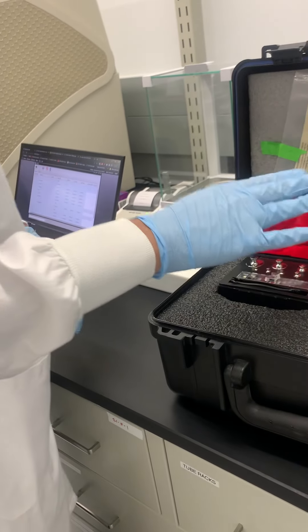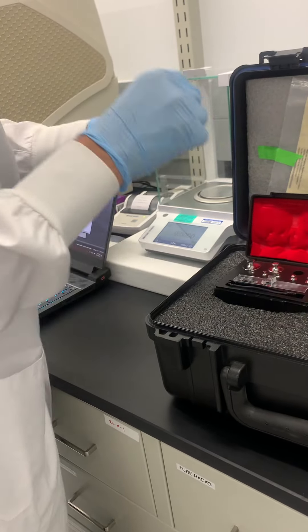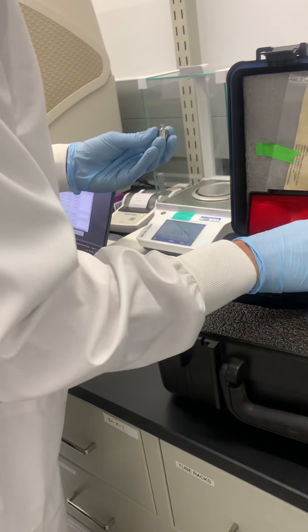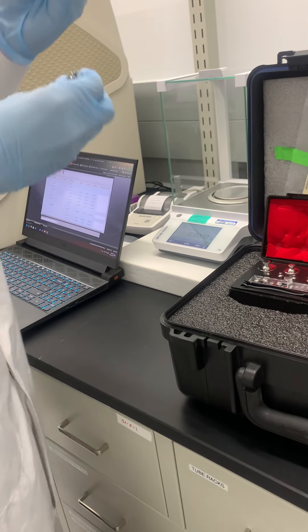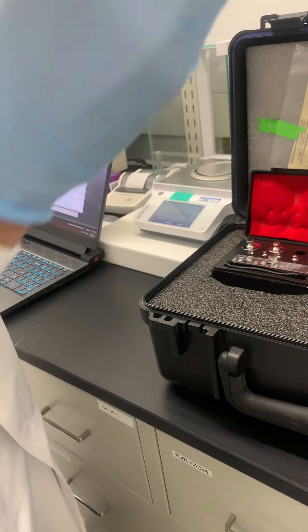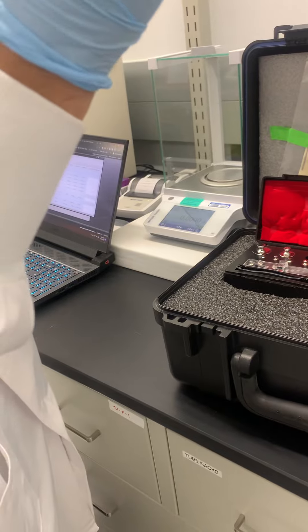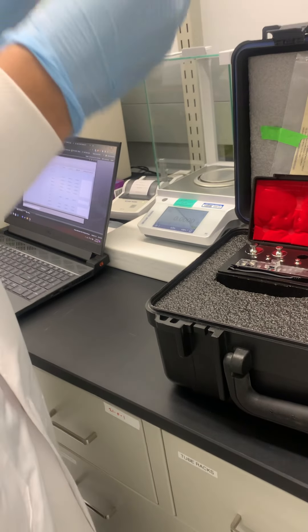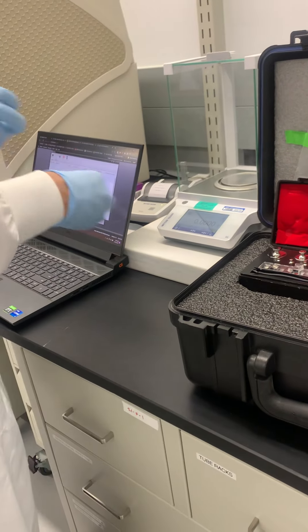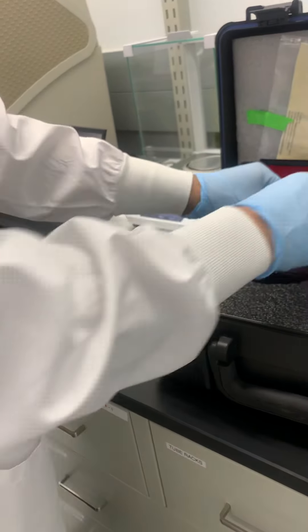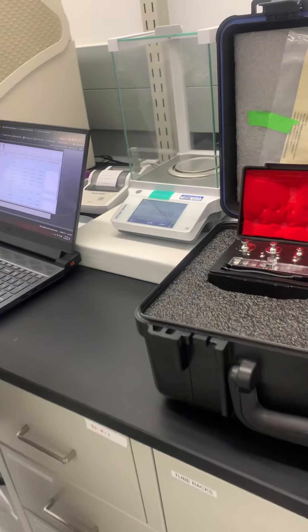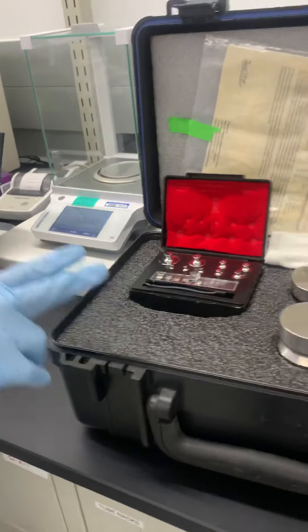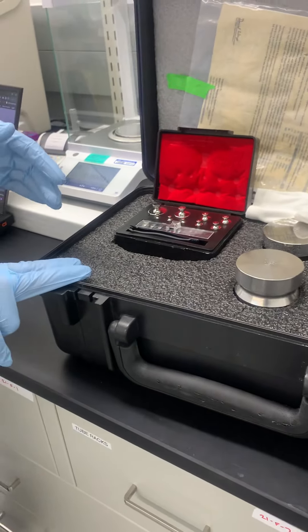This is a 50 gram weight. Also sometimes for these weights, like this is a 20 gram weight you can see, and this one's a 20 gram weight with a dot next to it, you have to make sure that you log that information. Oh really? Yeah, your weights used. Oh exactly, like this is the weight set, use these specific weights.